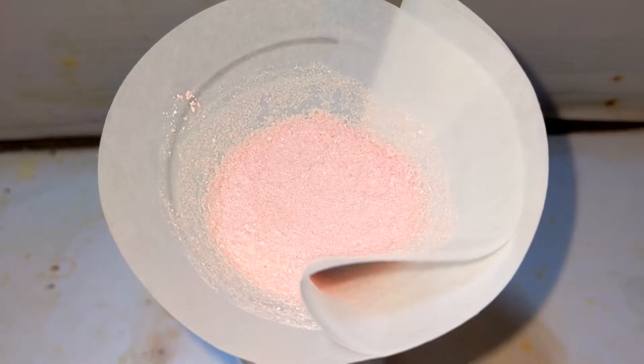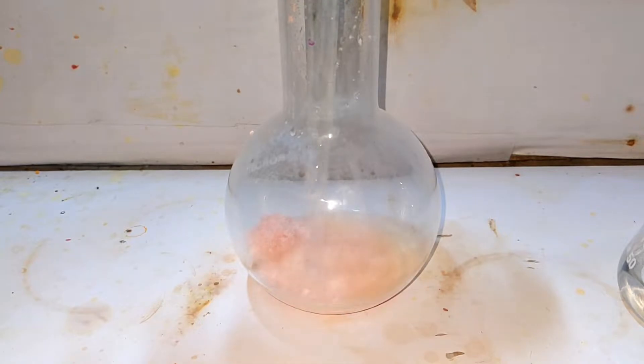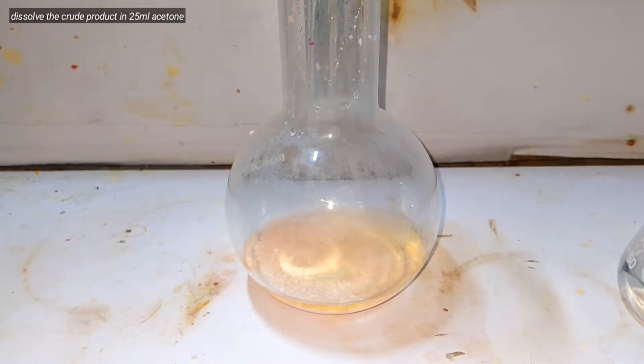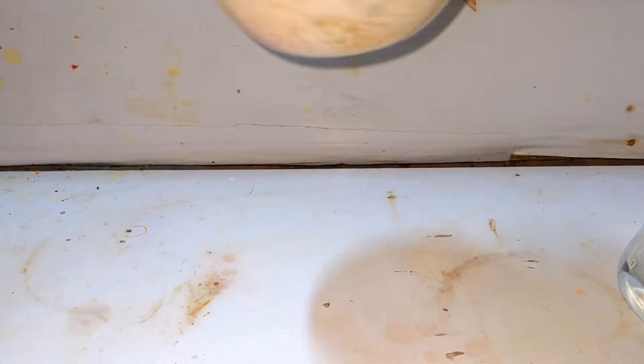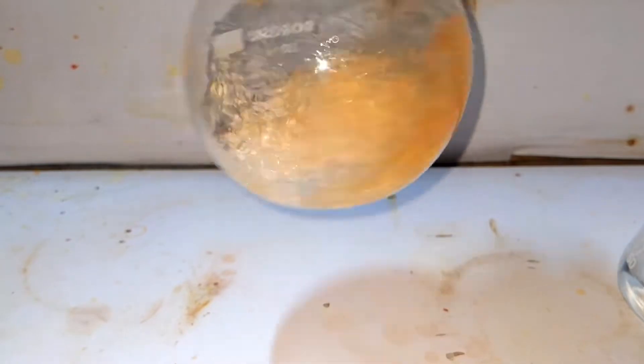Finally, I decided to filter the product using a simple gravity filtration method. The crude product was then transferred to a flask and about 25 milliliters of acetone was added. The flask was gently swirled. Thymolphthalein is extremely soluble in acetone, but phthalic anhydride is insoluble in acetone. So after mixing, you can see all of the phthalic anhydride that was present is not dissolved.